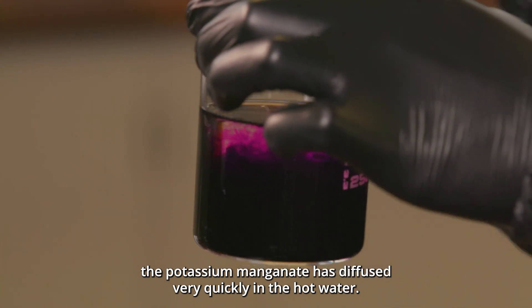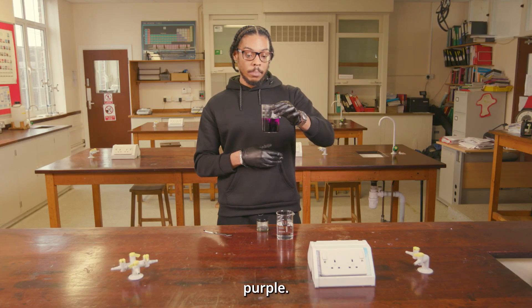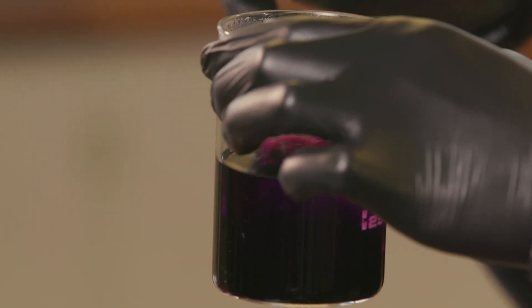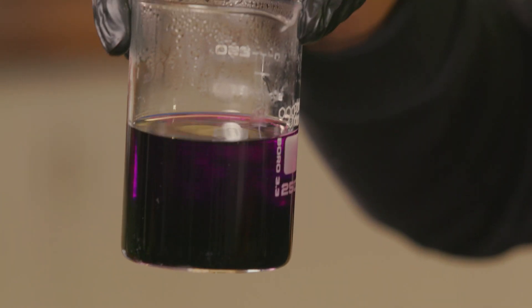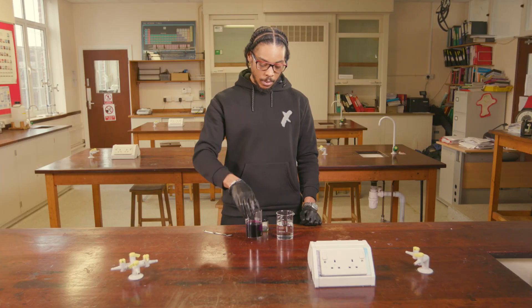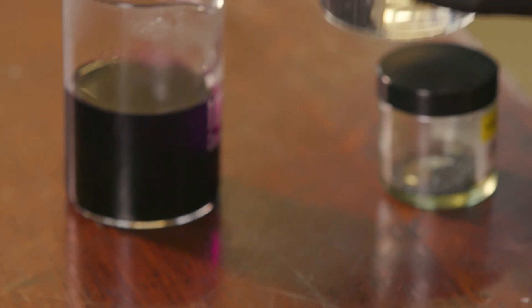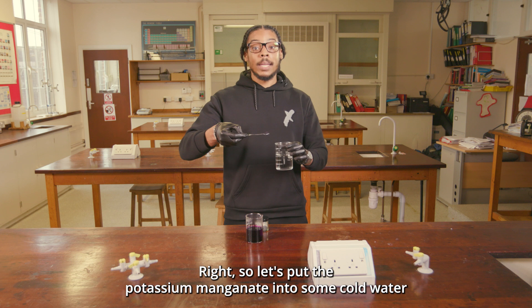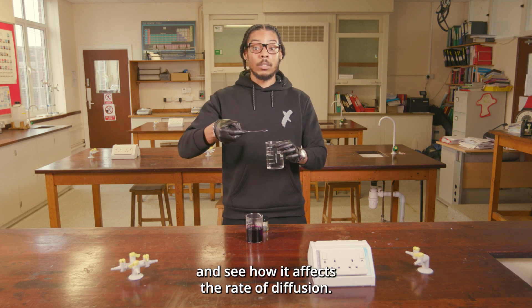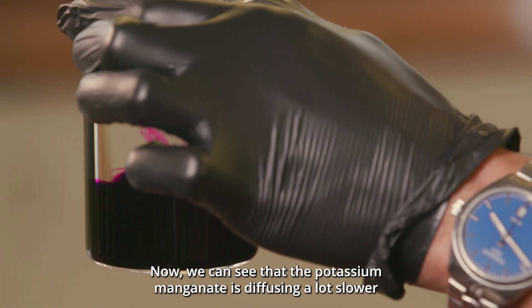We can see that the potassium manganate has diffused very quickly in the hot water — the solution has now turned completely purple. Now let's put the potassium manganate into some cold water and see how it affects the rate of diffusion.